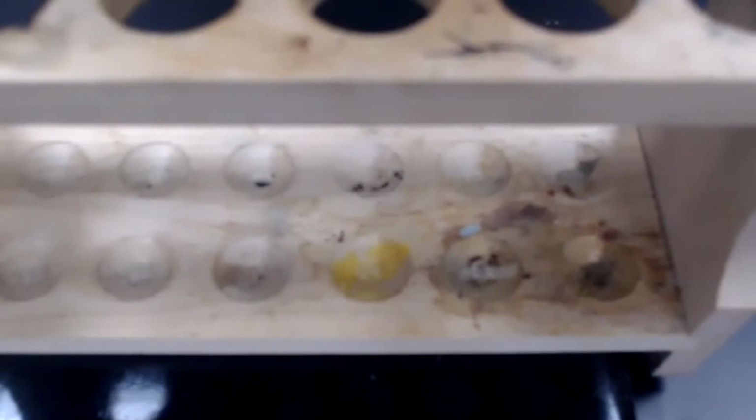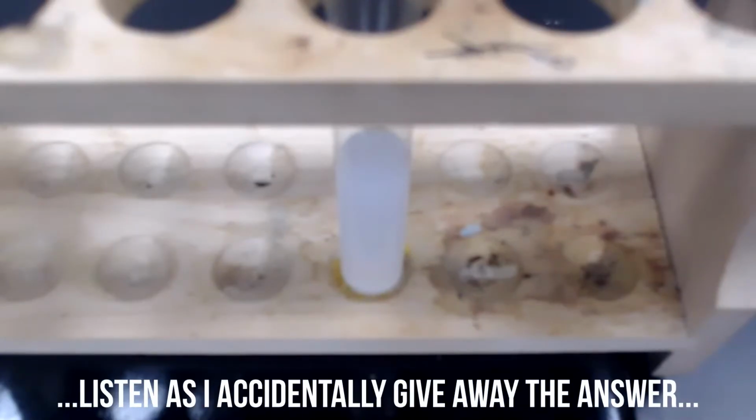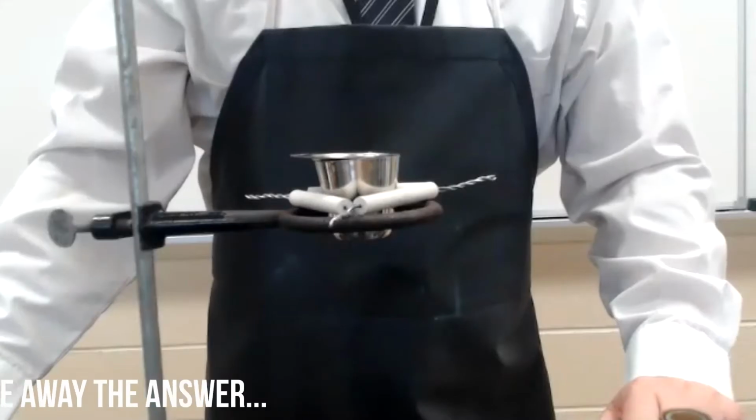If I mix the test tube, the rest of the solution will begin to precipitate as well. If I allow the test tube to rest undisturbed, the solid that forms as a result of a chemical reaction will settle to the bottom.